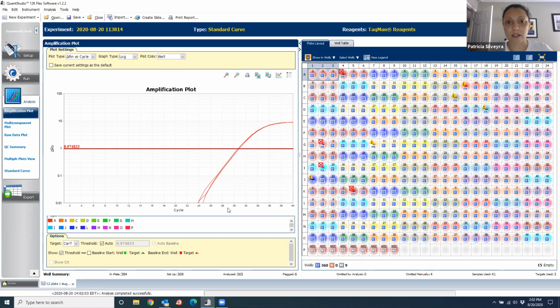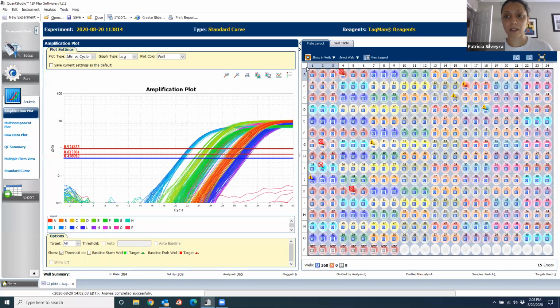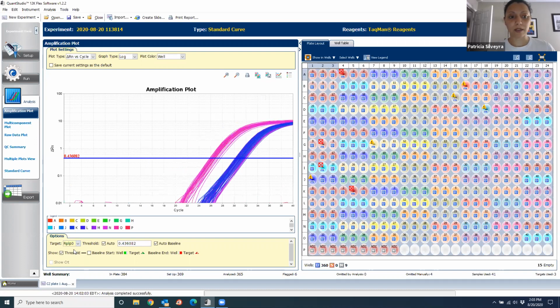That is called the cycle threshold, or the CT value, which is what we are going to report to the PI. However, the machine calculates this automatically using an algorithm that looks at the higher and the lower peak, and a lot of math in between. But what we found that is useful is to always have the same threshold for the same gene. And in order to do that, we look at the curves for the whole gene together, which I can do if I click on the full plate and select one gene, for example, RPLP0. And for me, usually it's 0.4 for everything.